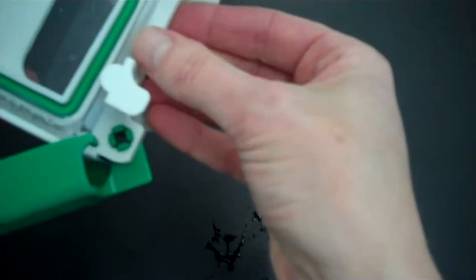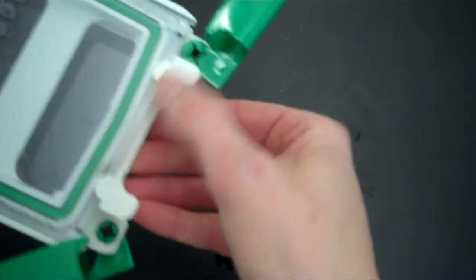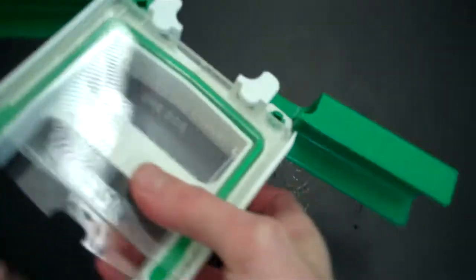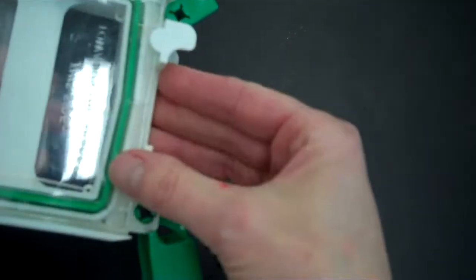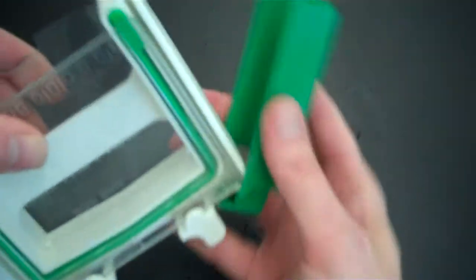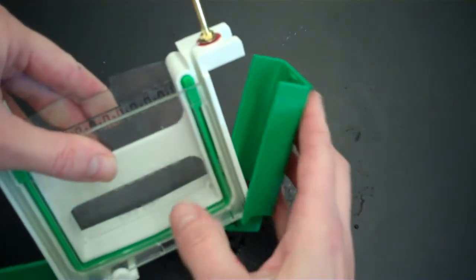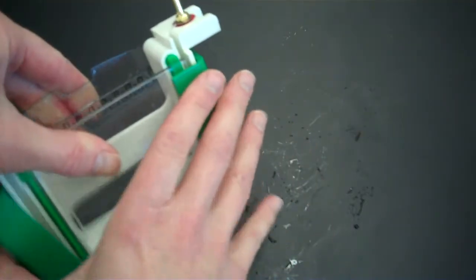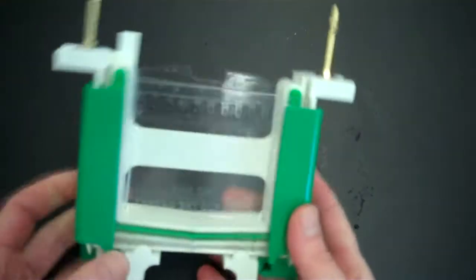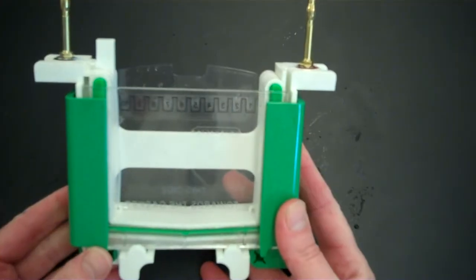So now I'm going to make sure that they're both put into the chamber. You can inspect the bottom here to make sure that it is all the way down. You're going to want to inspect the bottom here as well, make sure that the plates are all the way down. And then you take the green wings and you just simply close it. So now we have assembled the inner chamber.